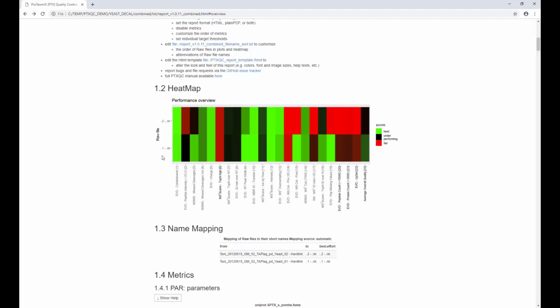The heat map is color-coded. If you see a green tile, that means very nice. You always want to see green. If you're seeing black, that means, well, this metric is underperforming and might need further inspection. If you see it red, that means, well, something went very, very wrong, and you should definitely look at this.